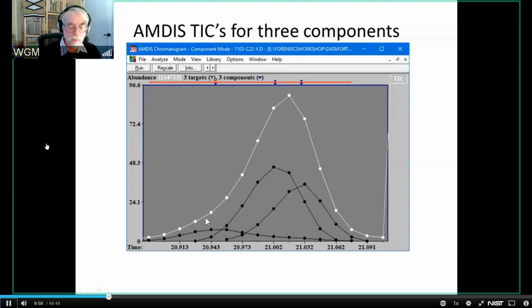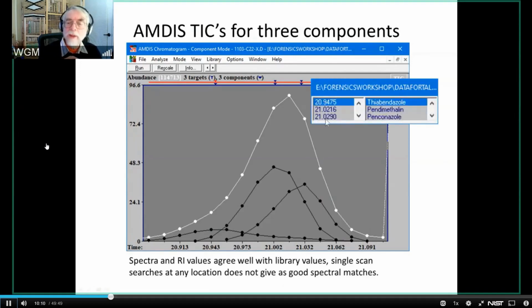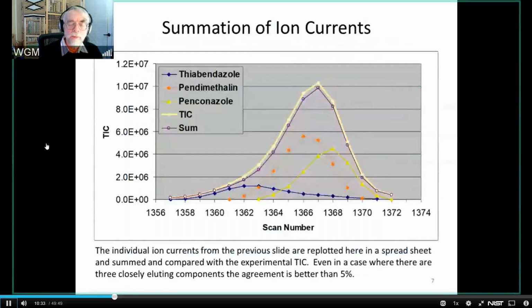And it's useful to say, well, how good a job are we doing? And so I just want to show you what happens when you take these three components, the TICs, and you sum them. These are the three components that we found. And the data, both in terms of the RI values and the spectra, agree very well. But the real question that I want to explore a little bit more is, are we actually also getting quantitative information out of this? Unfortunately, you can't do this within AMDIS, but you can take it out into a spreadsheet and do it. And here are the TICs for the three components. They're the blue, the orange, and the yellow with the triangles. This is the experimental TIC that you get from the instrument.